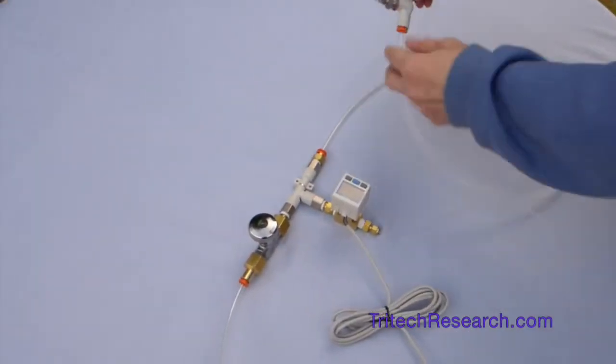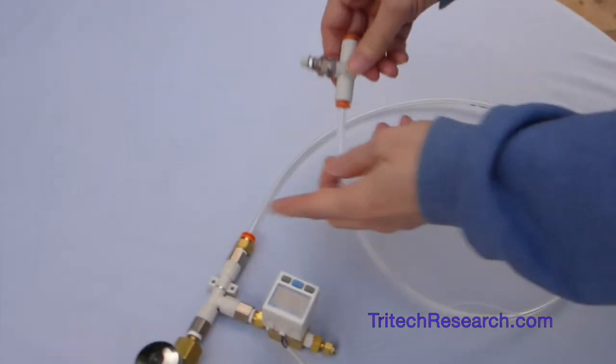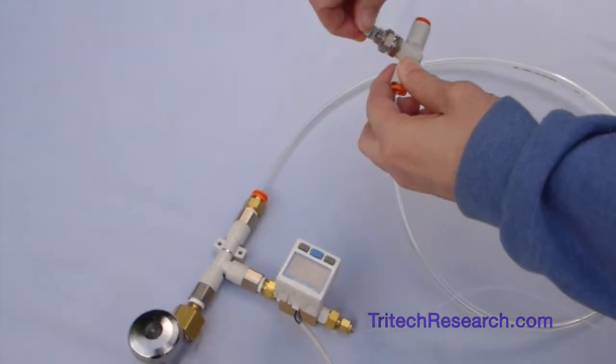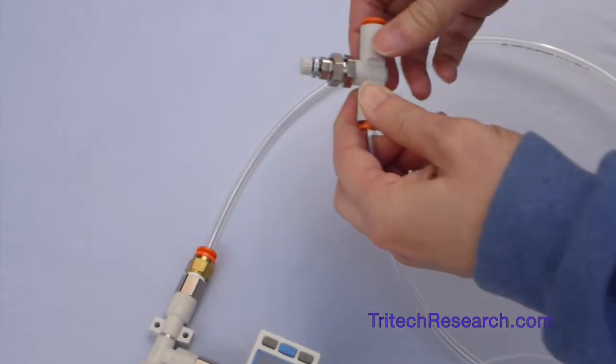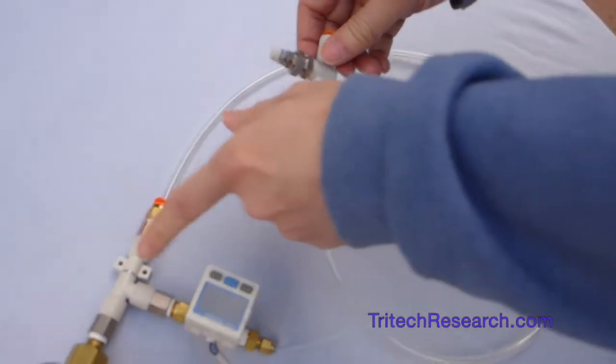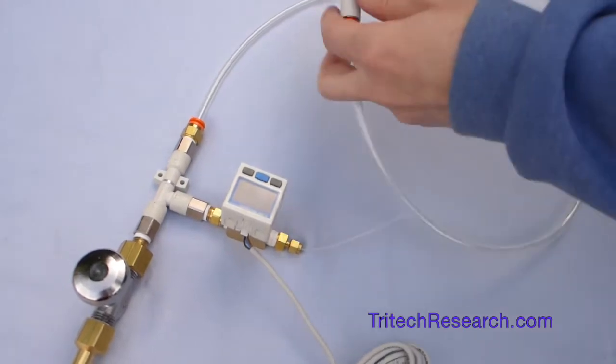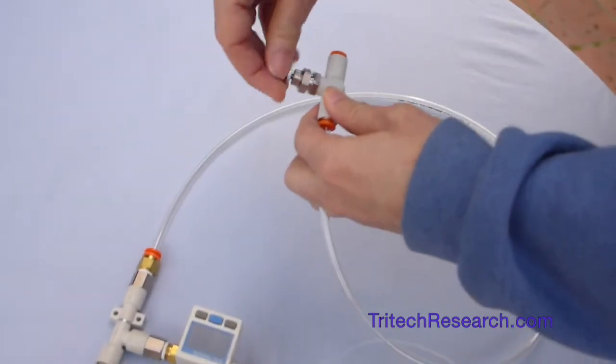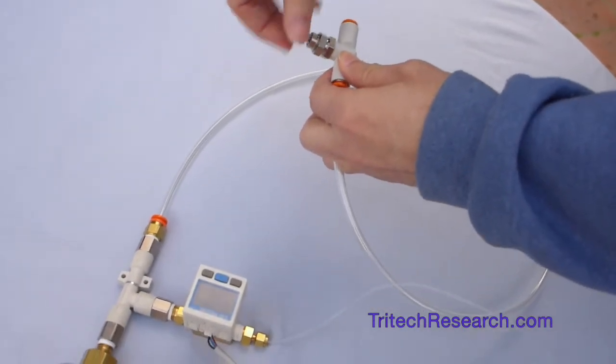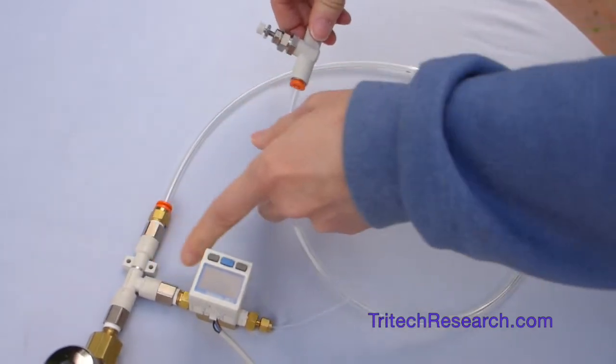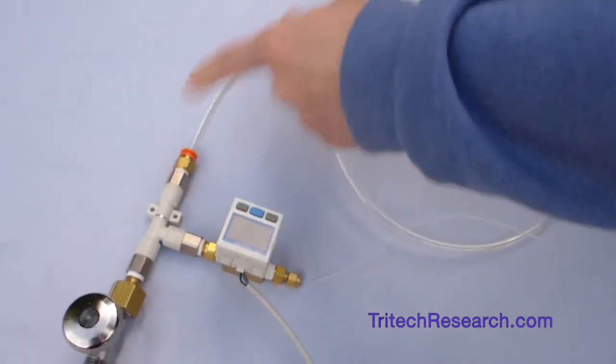On the other hand if we prevent gas from flowing out the output by turning this clockwise, then the positive pressure is going to be applied directly to the output. If it's completely open by turning it all the way counter clockwise it's going to create a strong vacuum because there'll be a lot of flow through here.